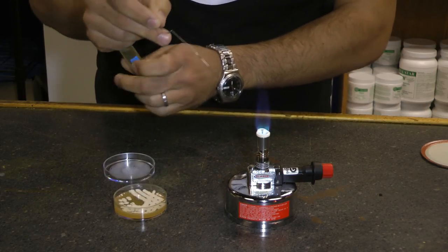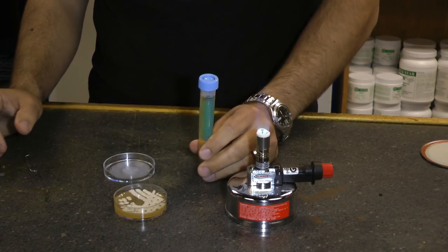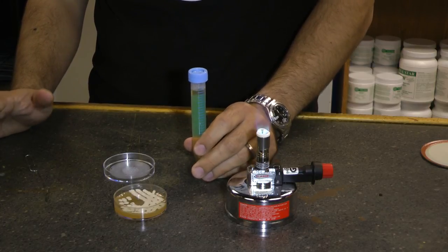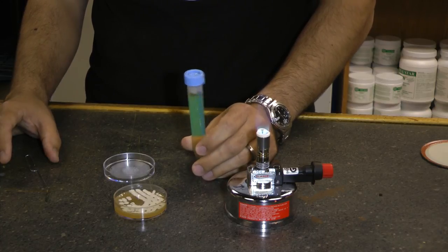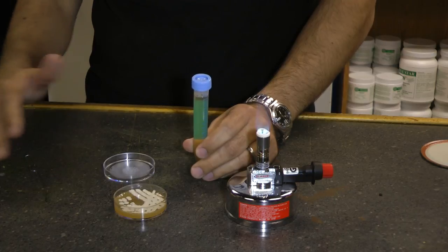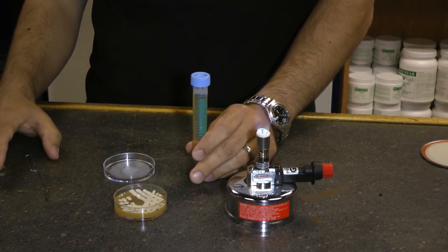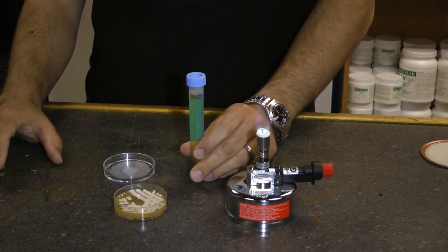Get a vial — it's in the kit. Fill it with low gravity wort: 1010 or 1020 is all you need. This is going to be your super tiny yeast starter. Take the end of the paper clip, dump it in the tube, shake it around, and just make sure you get it off the end. Seal it up and shake it up. Once you put the colony of yeast in your tube, incubate it as you would any other starter — a few days, shake it up, add it to another starter. I usually go from about 10 mils to 100 to a thousand, just building it up gradually using low gravity wort: 1010, 1020. You're good to go.